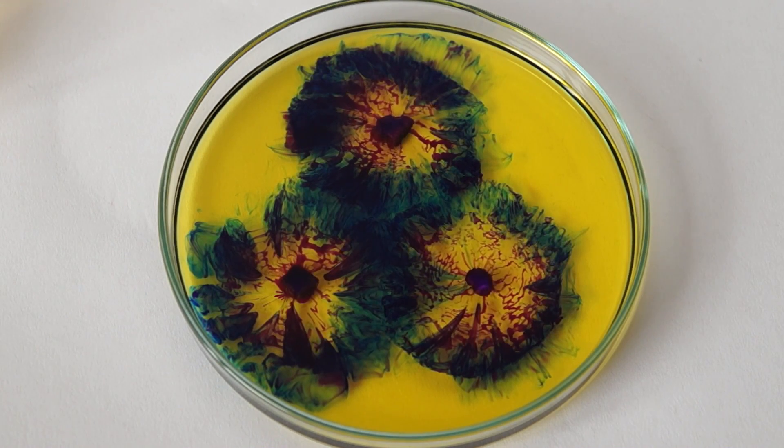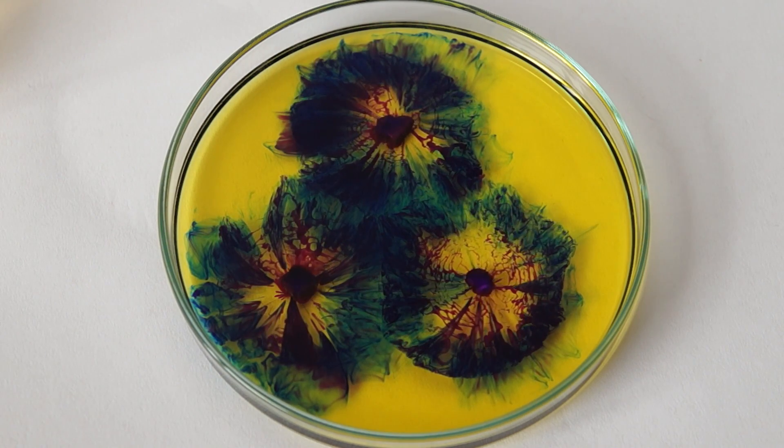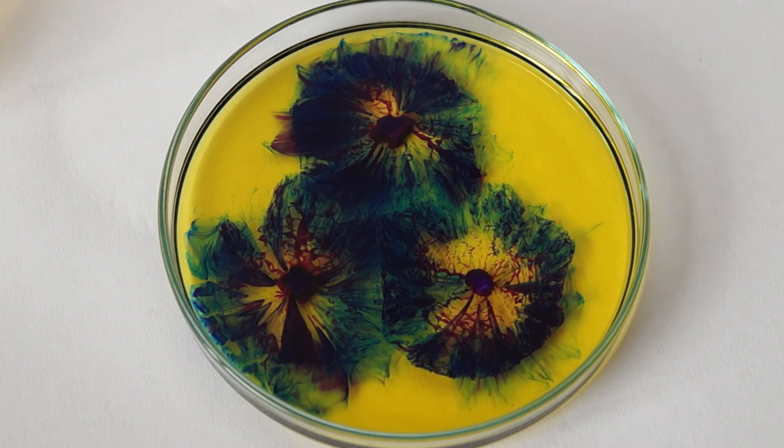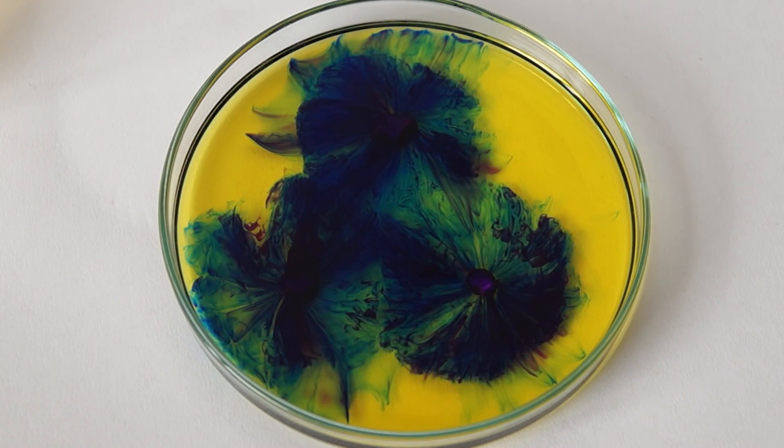Since isopropanol has a high viscosity, you can observe an interesting effect of slow diffusion of alkali. In this case we can see a very beautiful effect of floral formation.